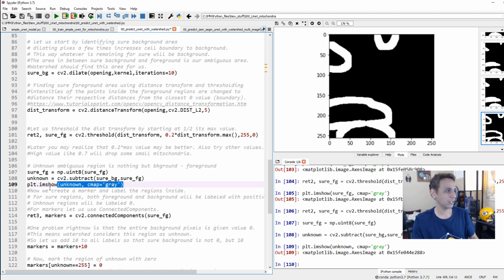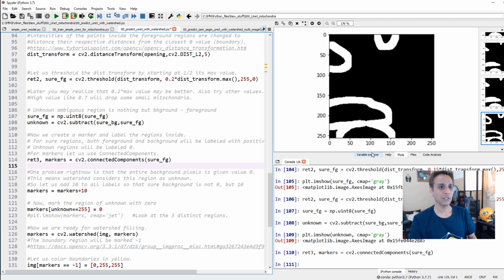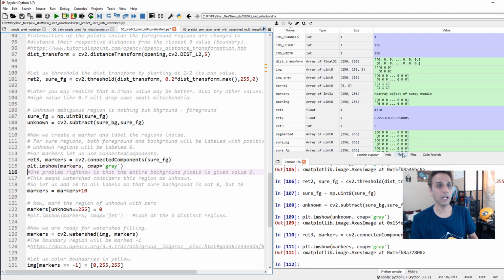I wasn't planning on giving a watershed tutorial again, but if you don't come from that background, this can be a very useful lesson. Okay, now what are we doing? This part is, now we are creating markers and labels. This is traditional image processing again, right? So now let's actually set up our markers. So if you go up here, so what do we have? Our markers are 256 by 256. Can we plot it? Okay, let's go ahead and look at our plot, and there you go.